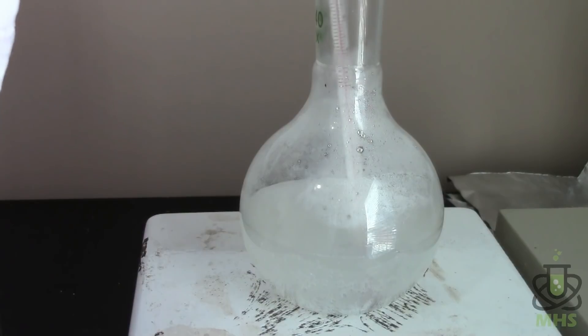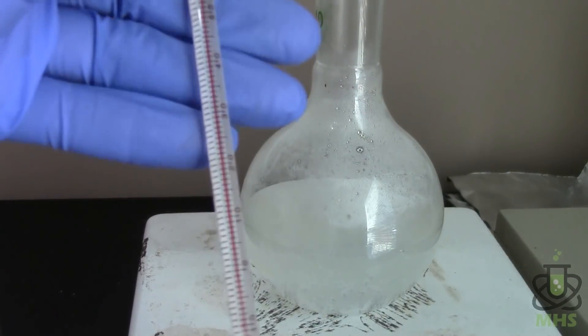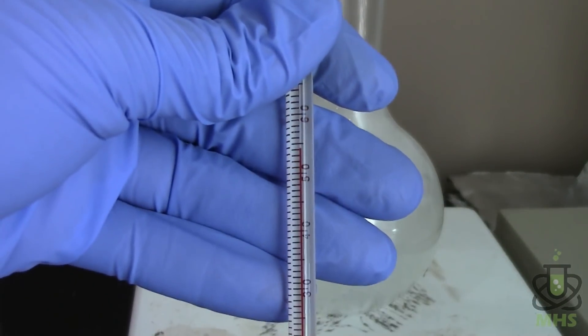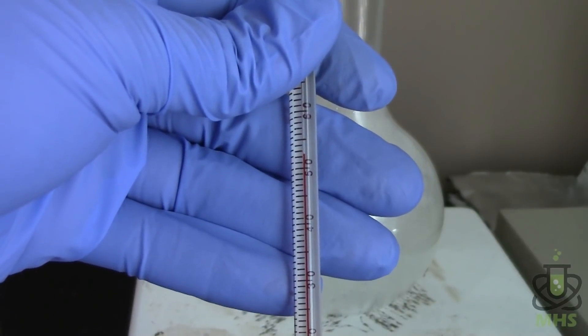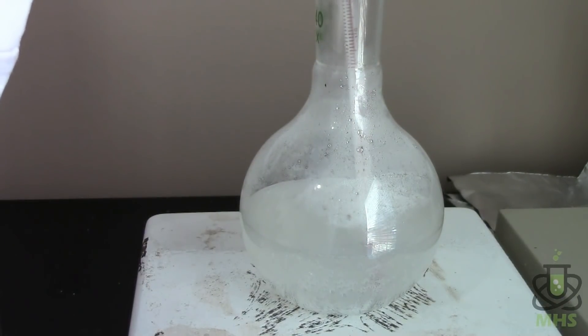Just a few minutes later and it looks like the solution is boiling but it's actually not. So let me show you the actual temperature. We're at about 55 when I took it out of there. So definitely it's like half as much as boiling water is supposed to be. So this is nitrogen that we're producing. So that's good news.